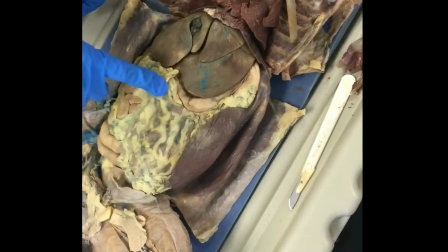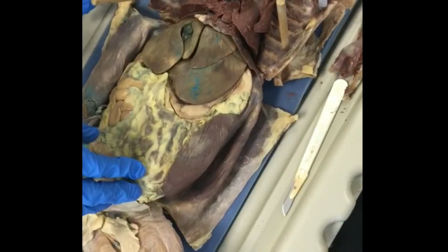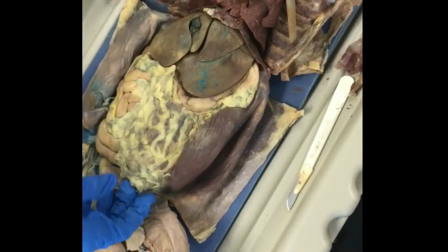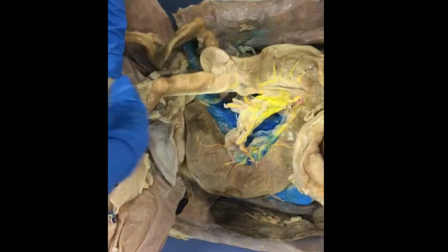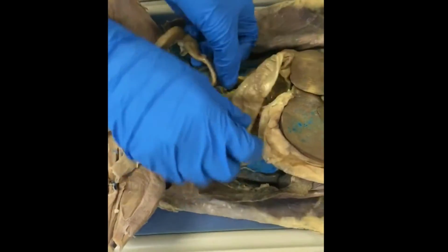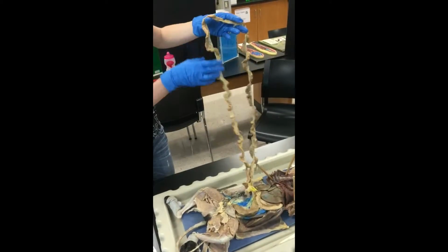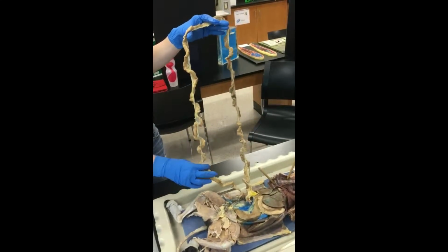This is the omentum right here, which is like a fatty tissue that covers the intestines. Its purpose is fat deposition, immune contribution, and infection and wound isolation. Okay, so as you can see right here, the small intestine, this is where it connects to the large intestine, and then this part down here is where it connects up into the stomach. As you can see, the small intestine stretches out and it's pretty large. It's probably about 3 feet in length.